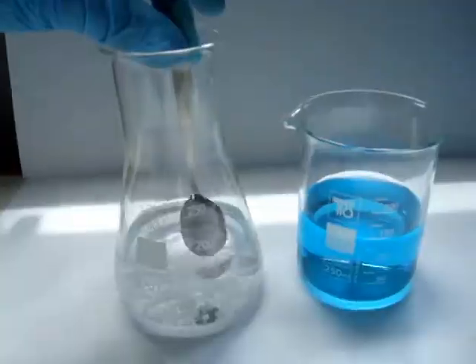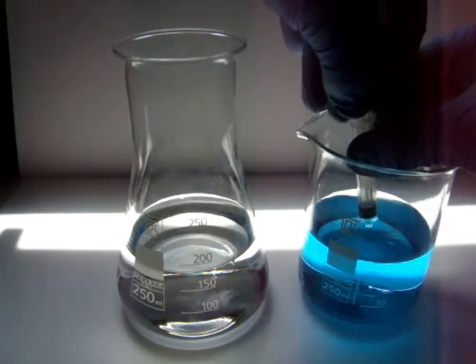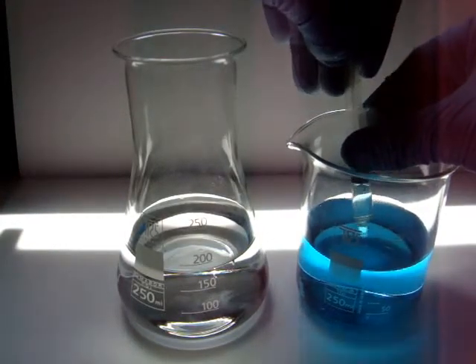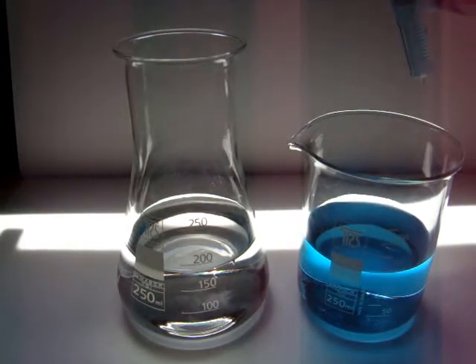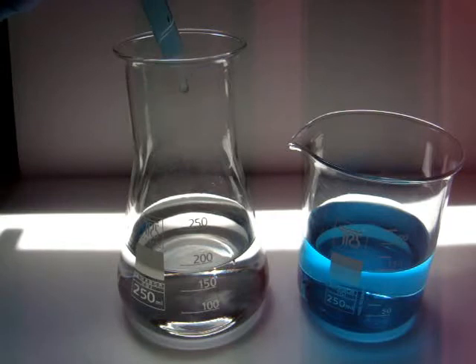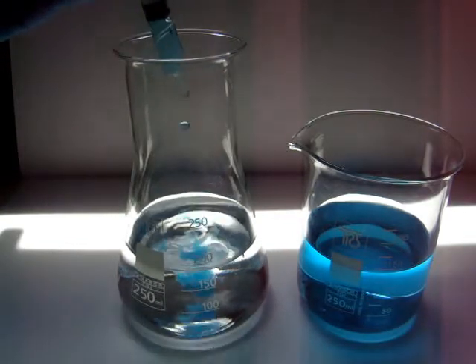Now with a syringe take a little bit of solution from the light blue copper sulfate and add it to the sodium hydroxide. A blue precipitate of copper hydroxide is forming instantly.